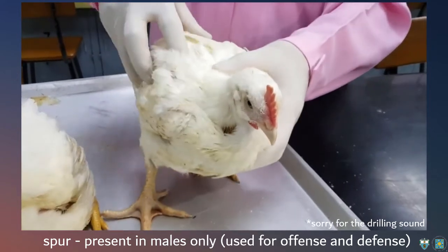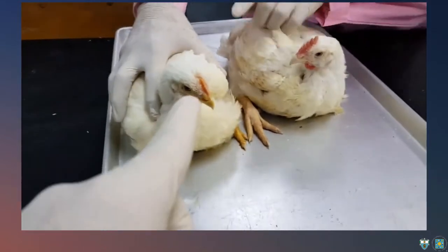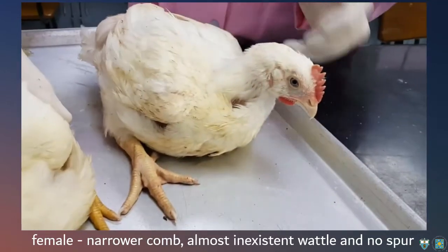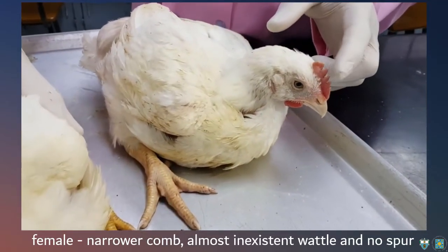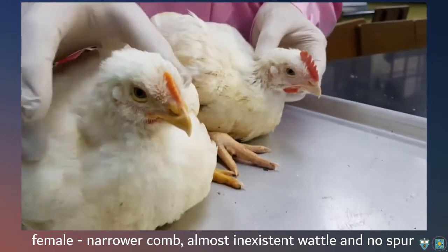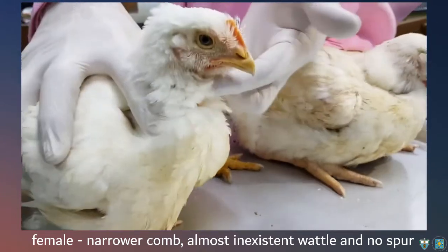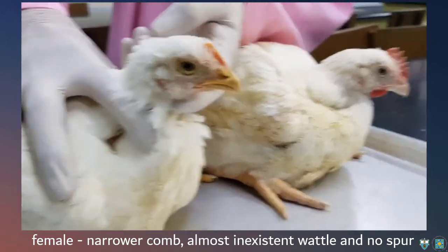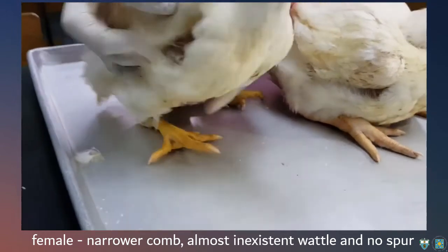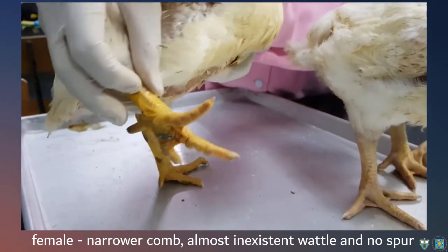Okay, so we can distinguish the female, one by the narrow comb. Okay, see, the comb here is wider than this one, and then the wattle, you see the wattle, it's almost non-existent in the female, in this female. Okay, and there is no spur in the foot. Okay, the spur.